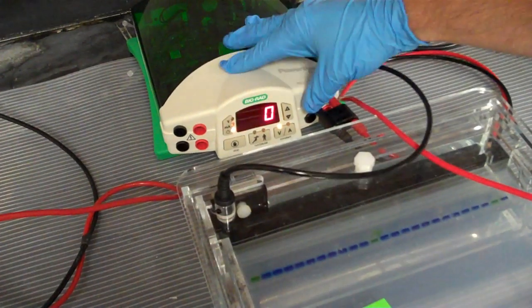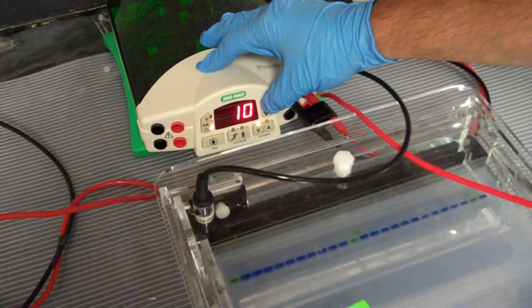And adjust your time. Time may vary, but typically it's run at 30 minutes.